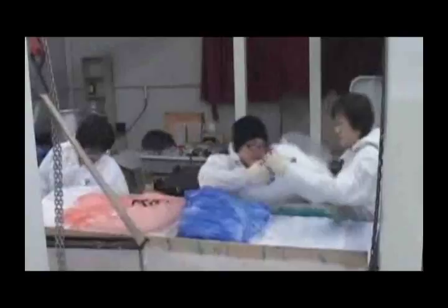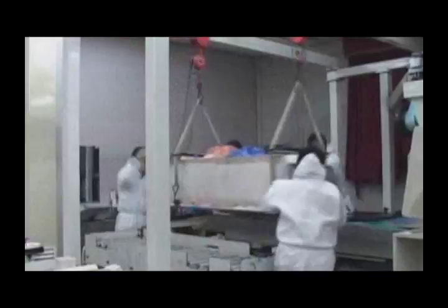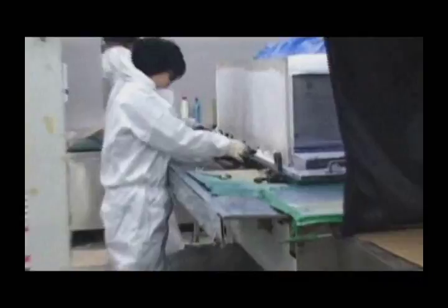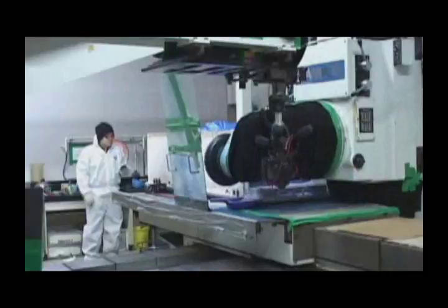The cadaver is already frozen in the box. I put the box on the cutting machine and tightly fasten it. This is a special machine designed to consecutively cut the cadaver. I cut the box into thin slices using the machine.